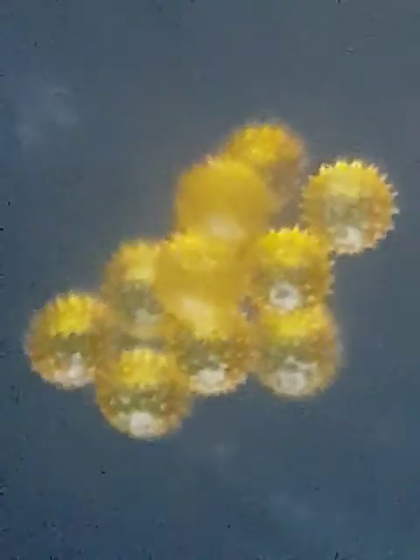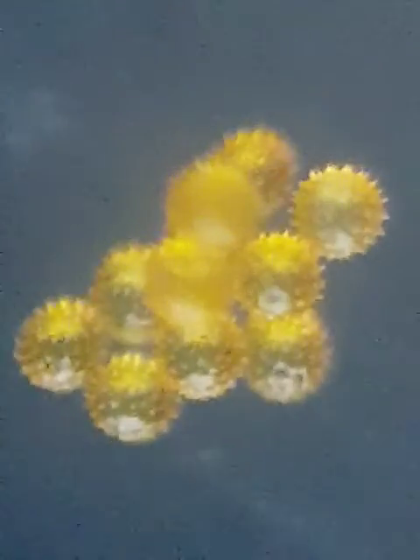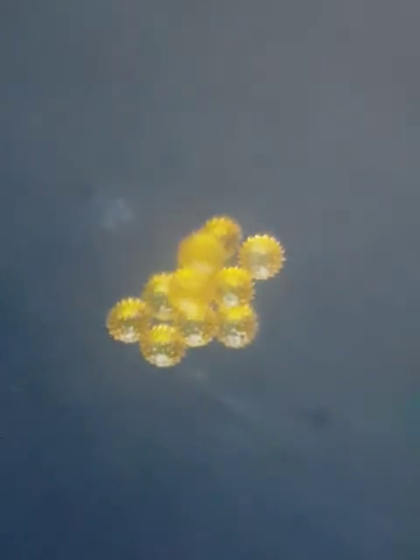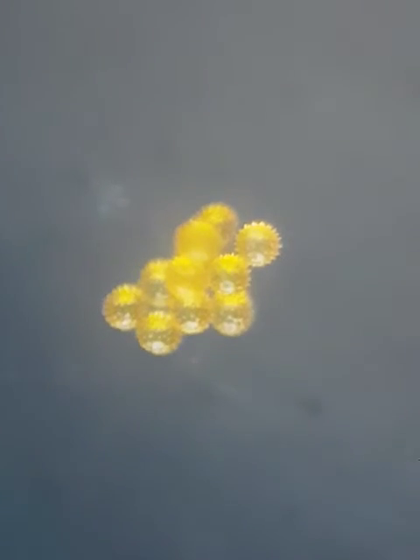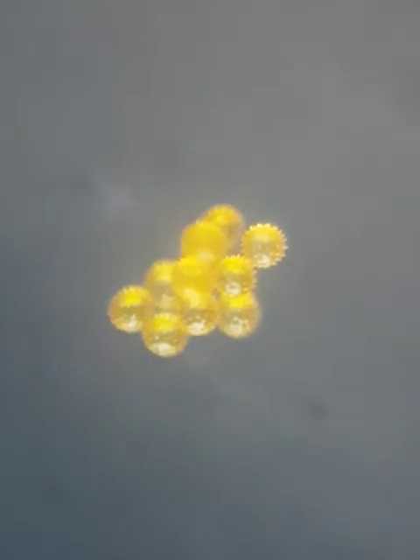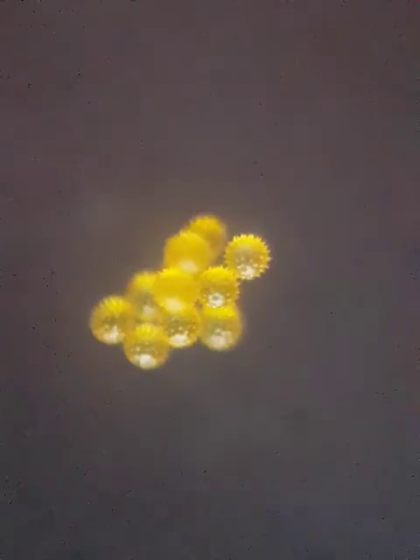You can see — that's what pollen grains actually are. Thank you so much for watching.